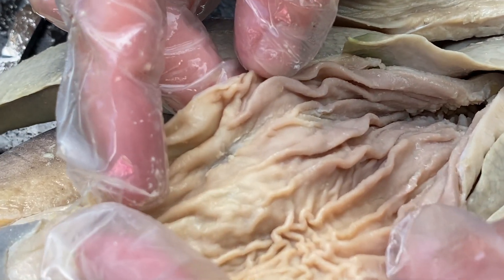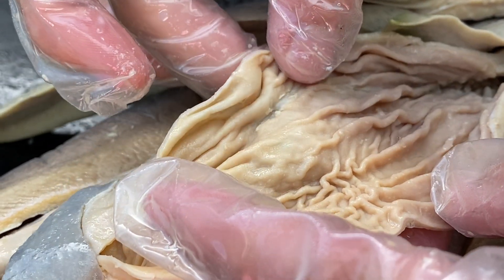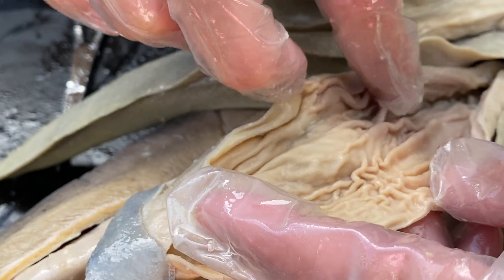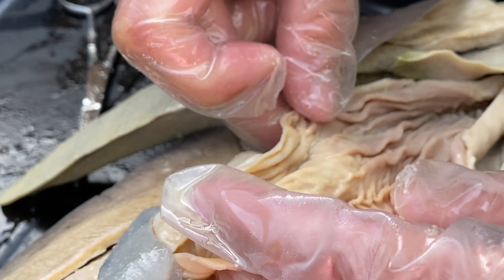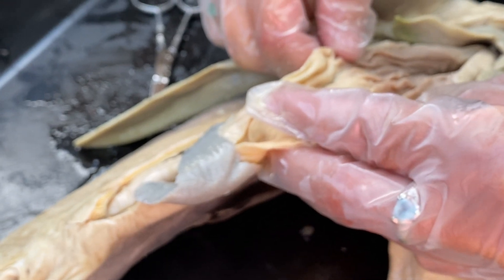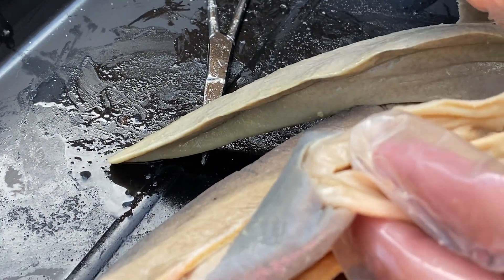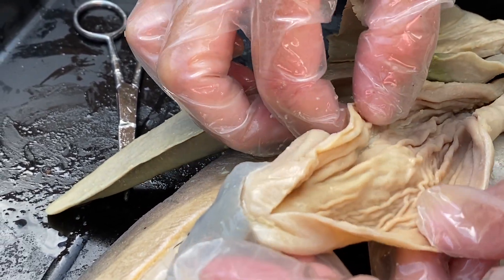These sharks are not exactly the best chewers — they're going to be chomping and swallowing really big pieces. I have found whole squid, whole crab, half-eaten fish before. And one weird experience — I had a bunch of little tiny black dots that looked like black marbles and I had no clue what they were. I had to call the company from where we bought these sharks. Turns out the shark swam through a huge swarm of krill, and all that was left were the eyeballs of the krill in the stomach. That was quite a unique experience. So you have your papillae in the esophagus, and you have your rugae in the stomach to increase your absorption of nutrients.